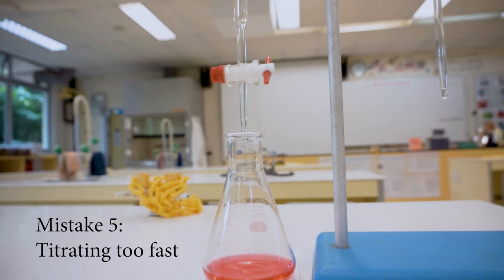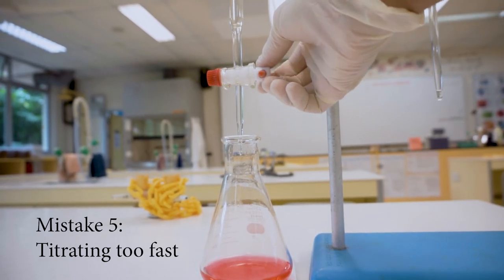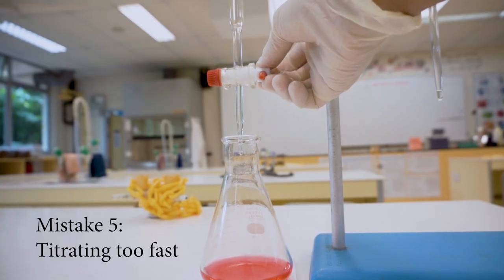Last but not least, mistake number 5 is that students often titrate too fast. Not doing dropwise will cause you to have inaccurate readings.